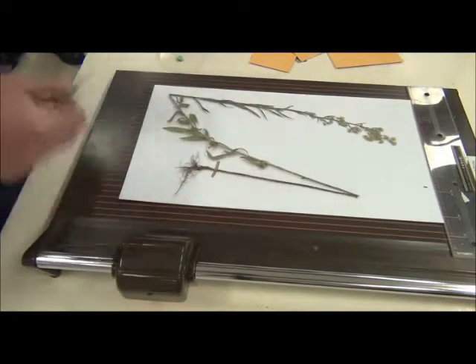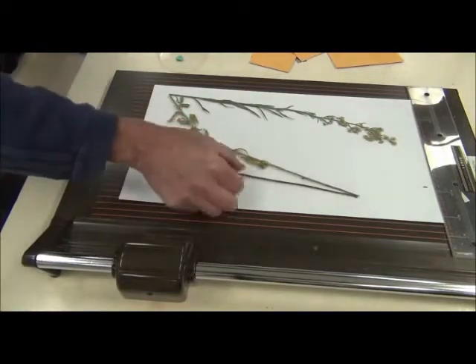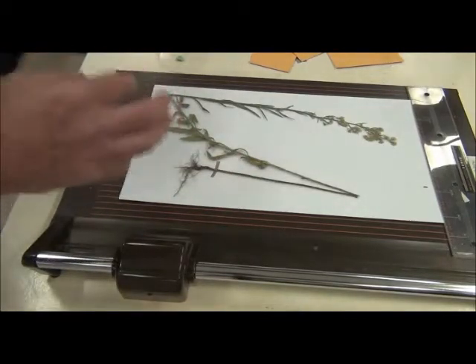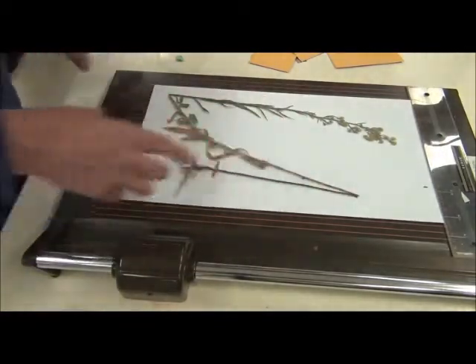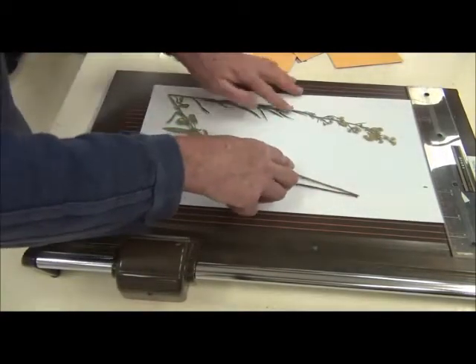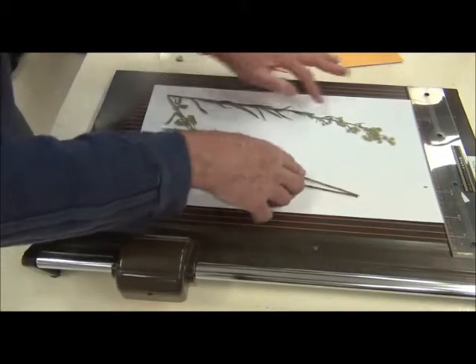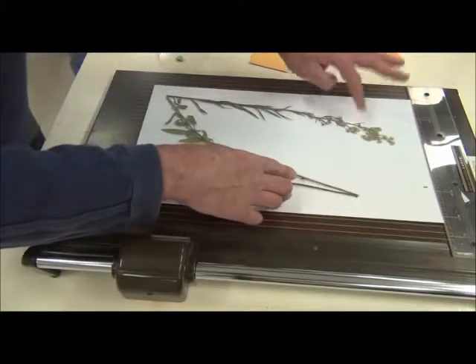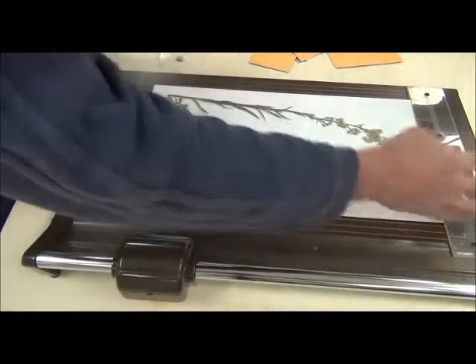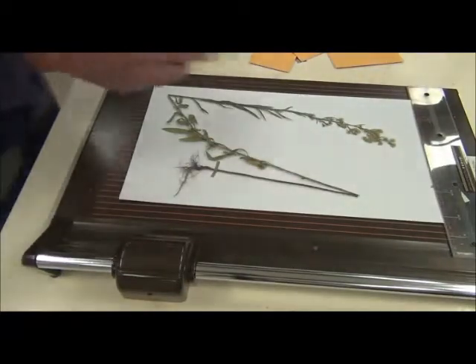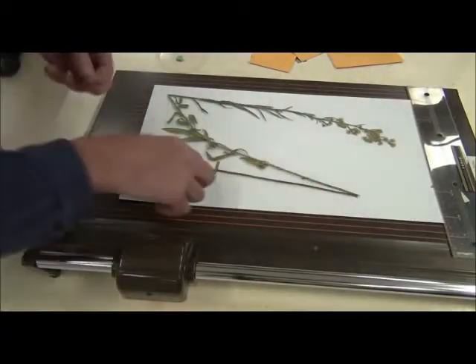And having done that, of course I'm not going to try it too much now, but that's going to secure it really well. So, now the question is how many more pieces do I need? Clearly I need something up there and some people might put it there. I'm going to come back a bit because, remember this is in a folder already and so this is where I use the smaller bits, so that's the thicker bit.